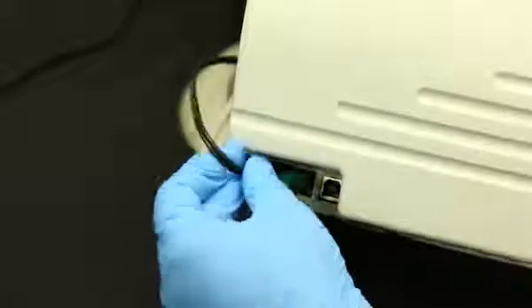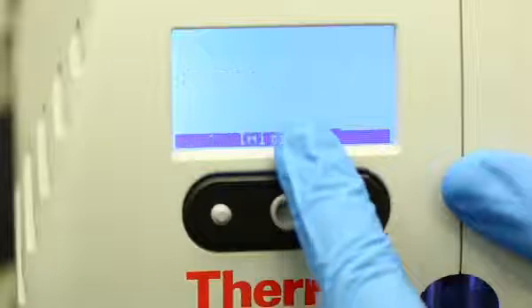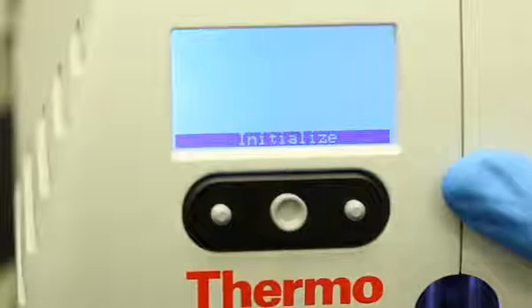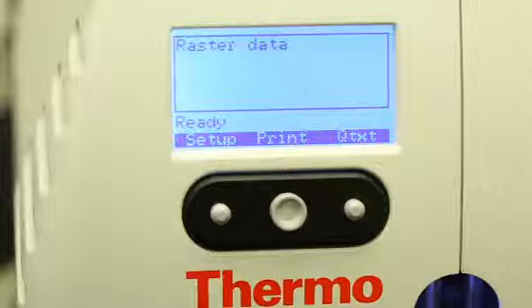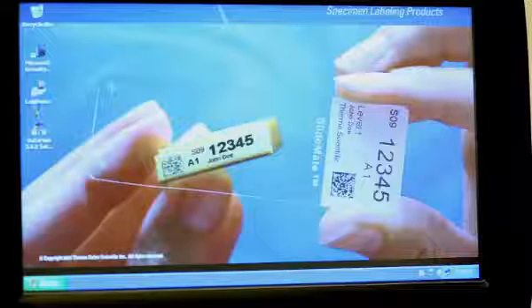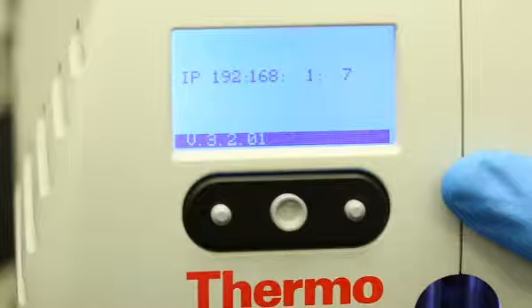Plug the SlideMate back in. Verify the IP address appears on the boot up screen. At the Initialize screen, press the middle button. Once you see the Raster Data Ready screen on your SlideMate, then reopen LabWriter. Try to print. Use this same process to resolve communication errors between LabWriter and SlideMate.